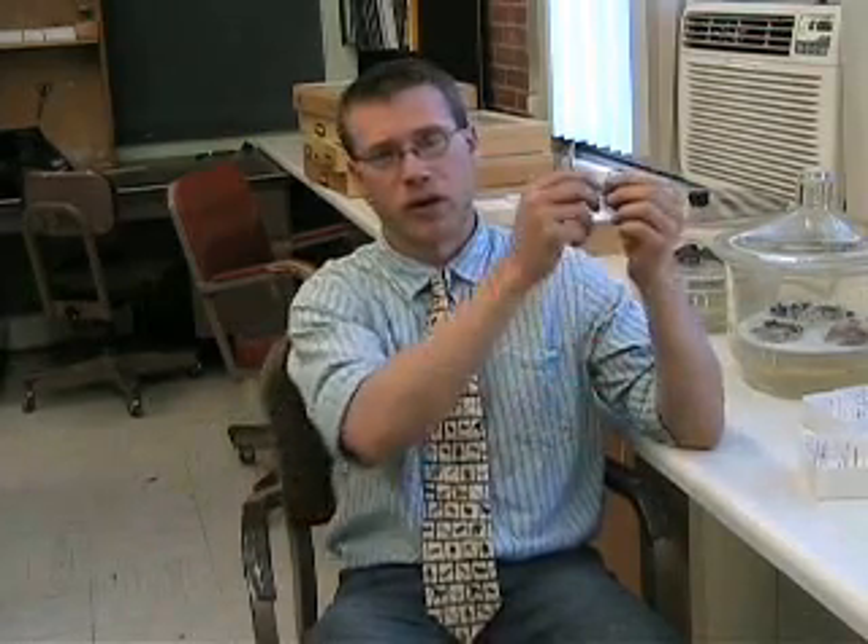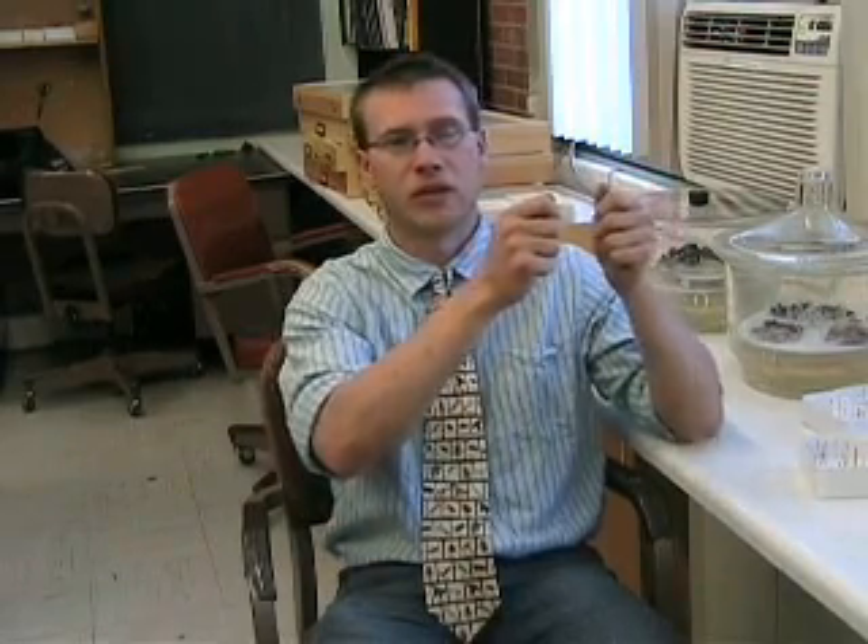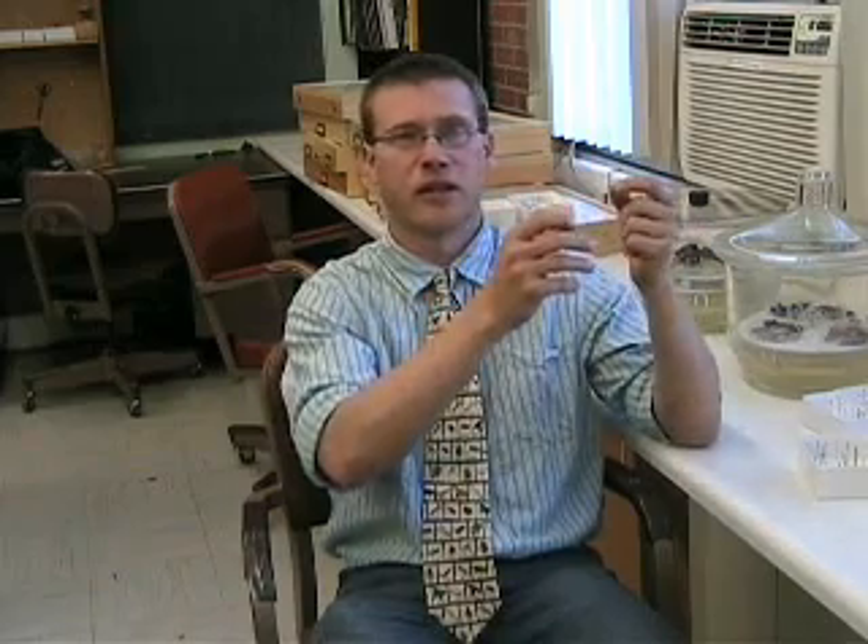There are many different pieces of equipment that you can use to spread Lepidoptera, butterflies and moths. There are spreading blocks from BioQuip — a piece of wood with cork or styrofoam at the base and two sliding panels on either side so you can spread it open and adjust to the width of the thorax. The problem with those wooden blocks is they're a little difficult to use on moths. They work pretty well with butterflies and larger Lepidoptera, but for smaller Lepidoptera like moths, foam blocks seem to be the best.